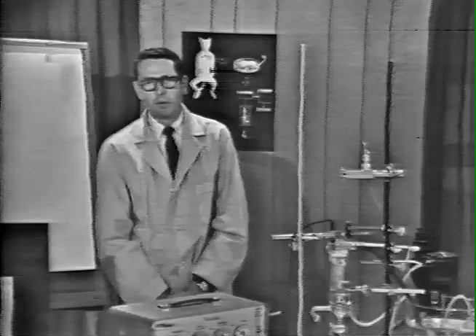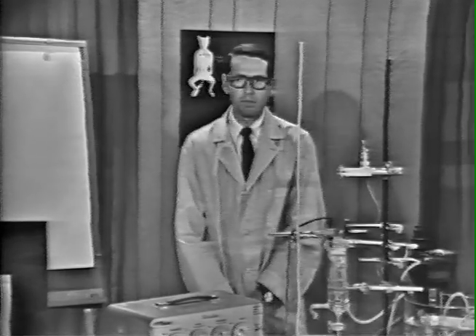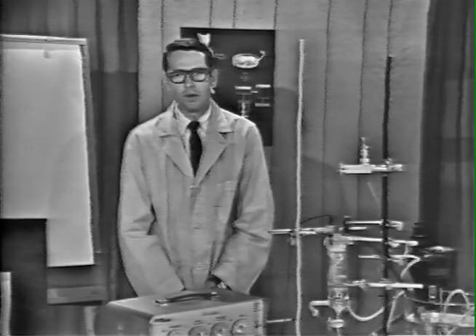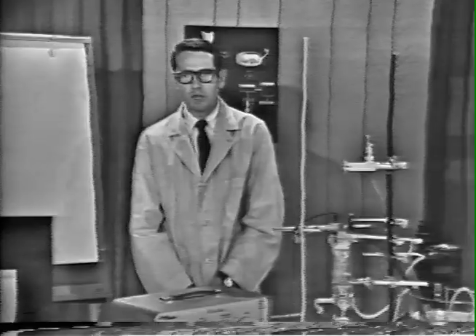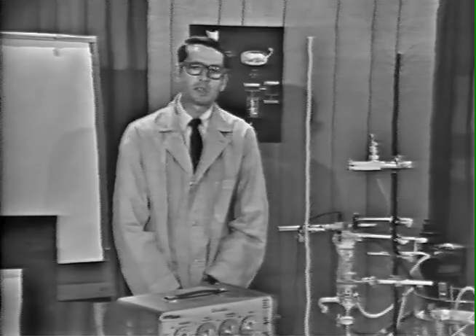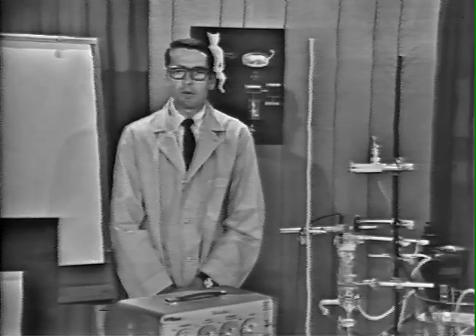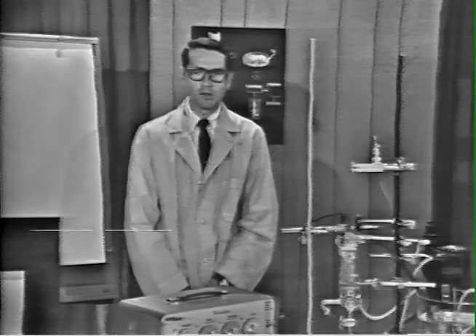The demonstration that we will present today is that of the sympathetically innervated cat atria. Now, the purpose of the experiments that we're going to do is threefold. Firstly, we'd like to demonstrate how a biological preparation can be used to illustrate both physiological and pharmacological principles. In this particular instance, we're going to be looking at the mechanisms involved in neurotransmission involving the sympathetic nervous system in the case of today's demonstration.